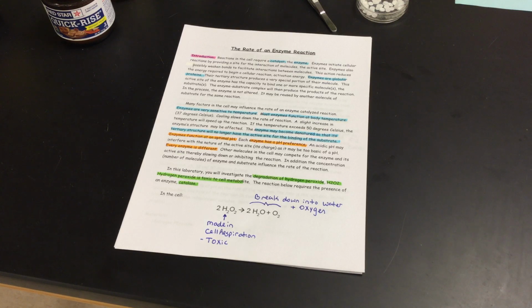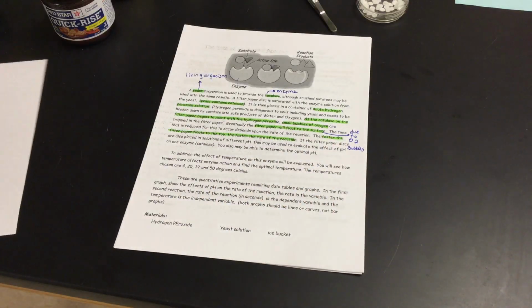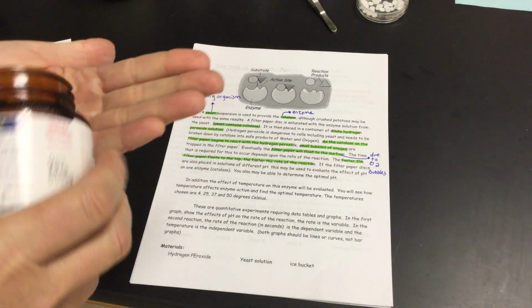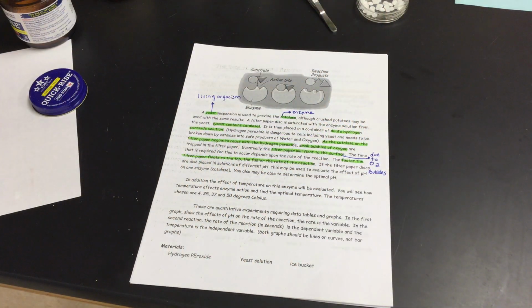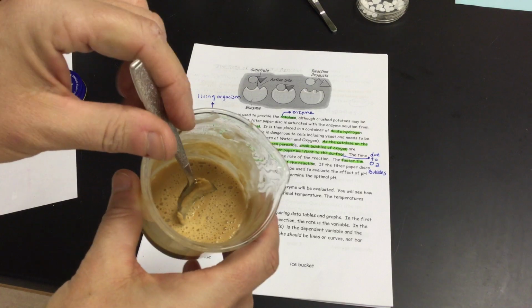What we're going to be using today, when we're looking at temperature as well as pH, and we'll talk about pH in a moment, is yeast. On that second page, you will see that. Yeast is actually a living organism, so you can buy it from the store. It comes in a container like this. It's very granular, so it looks like that. It's a living organism, dried at the moment. I put it with a little bit of warm water, and I gave it a little bit of sugar because it needs some food. I made it a little happy home. He's not very happy right now, but we'll see what happens. And he looks like this.